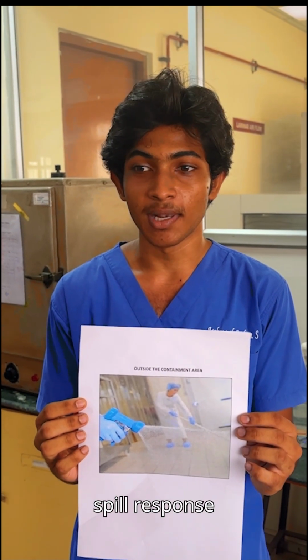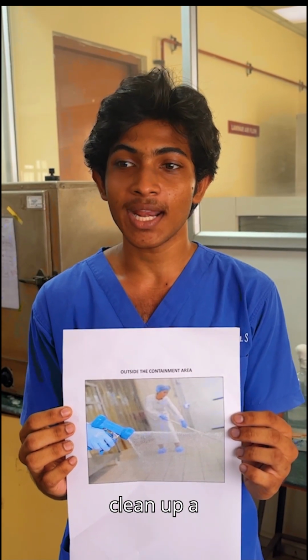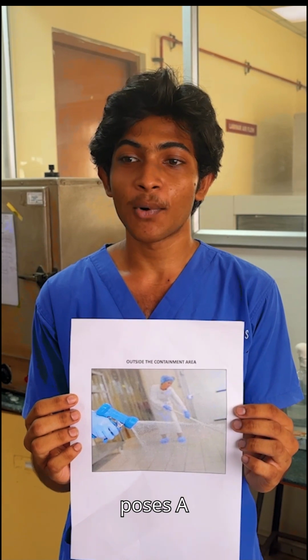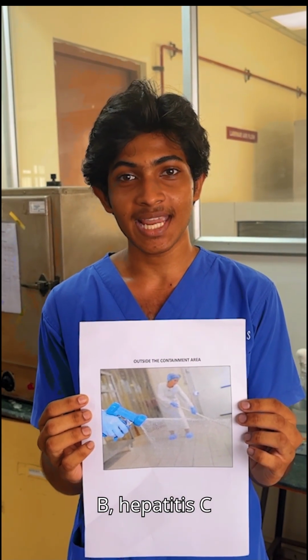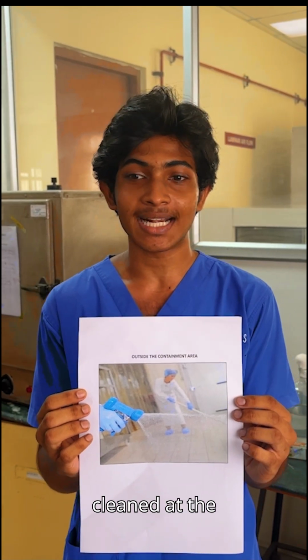Objectives of biological spill response: the plan outlines how to assess, respond, and clean up a biological spill. Spillage of blood and body fluids poses a substantial risk for the transmission of blood-borne pathogens such as hepatitis B, hepatitis C, and HIV. Small, few drops to large volume are considered infectious and should be cleaned at the earliest.